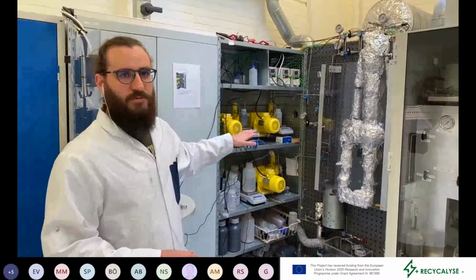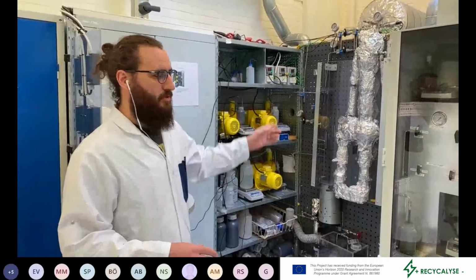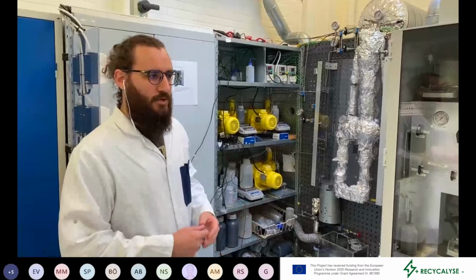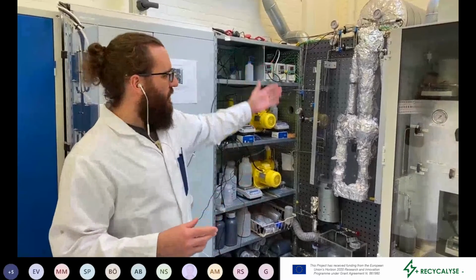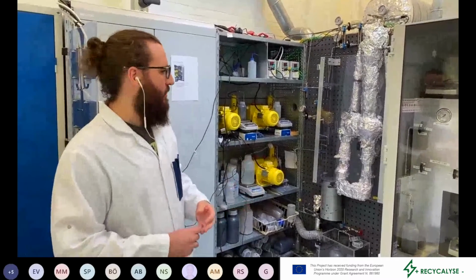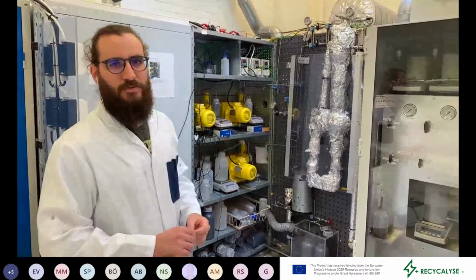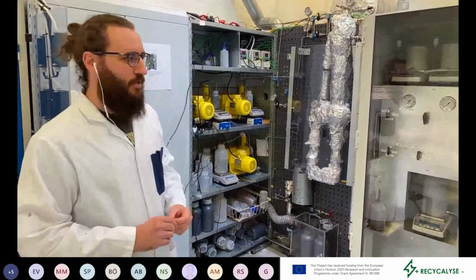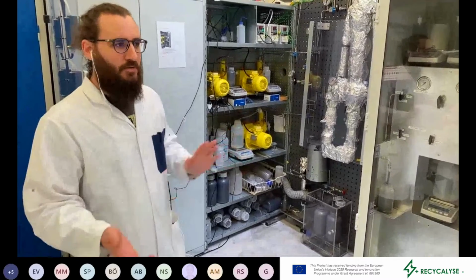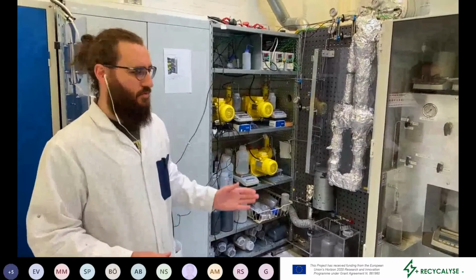Here, we usually run with fairly low flows of precursors because the tubing is fairly small. All of the tubing in the reactor is actually a standard 1/4 inch Swagelok. So if we want to have a good residence time during the reaction, so to have all the reaction happening, we cannot flow with gigantic flows. So we usually keep the precursor flow to 5 to 10 milliliters per minute. This is suitable for small synthesis, usually around 1 gram, maybe 2 grams. But if it's more than that, it starts to get a really long synthesis process here.